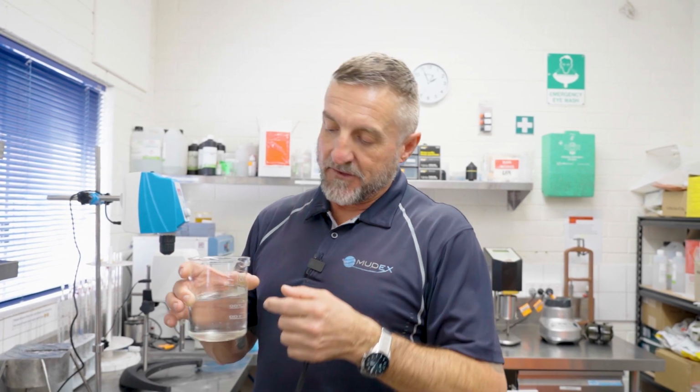So we can tell, and this will probably be around 10% dispersible at 5 minutes mixing in a low speed mixer. So we'll pass this as not dispersible at all.